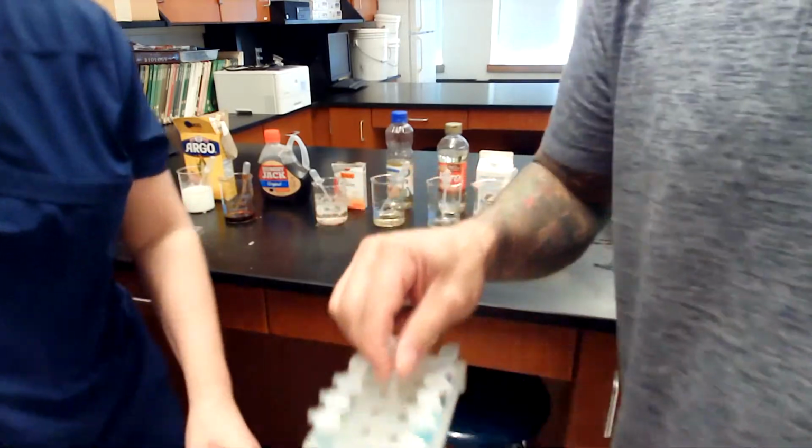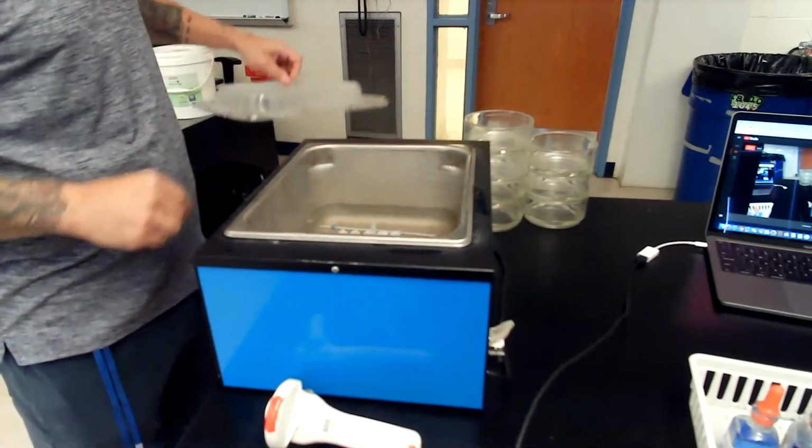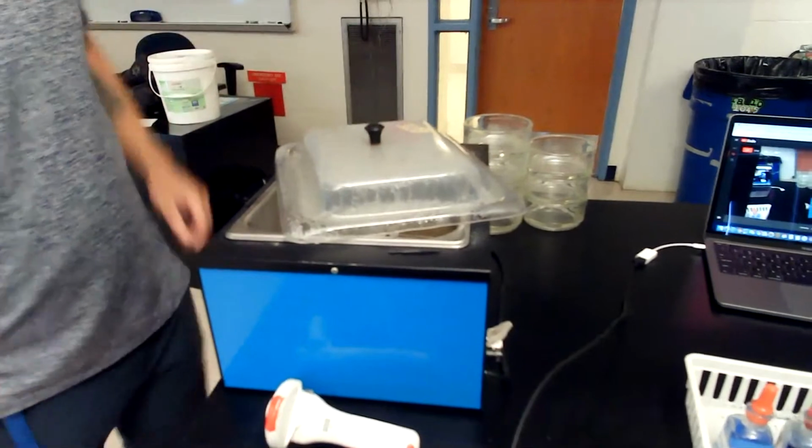Do you want me to? All right, yeah. And this will get set in our water bath. All right, and we'll leave that for 5 to 10 minutes in there. Okay.